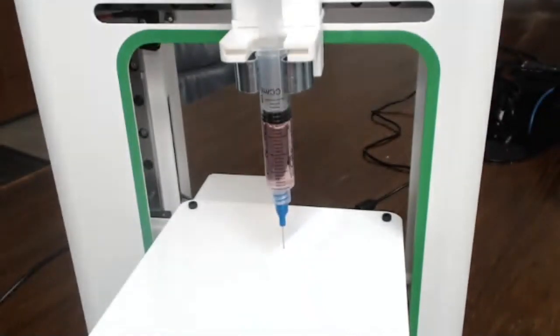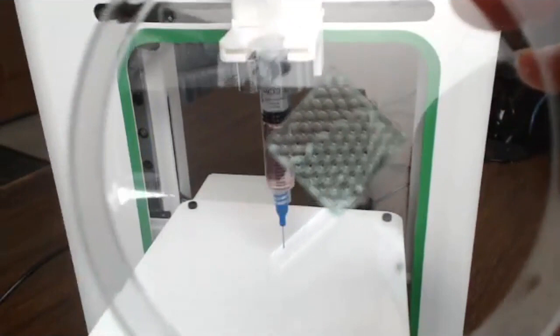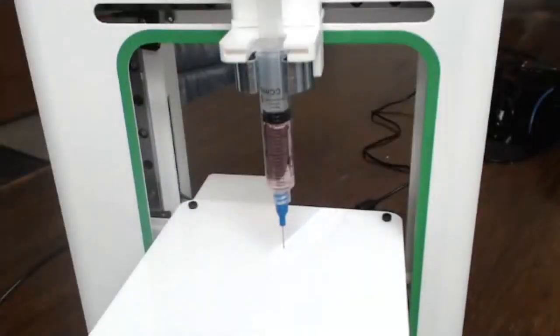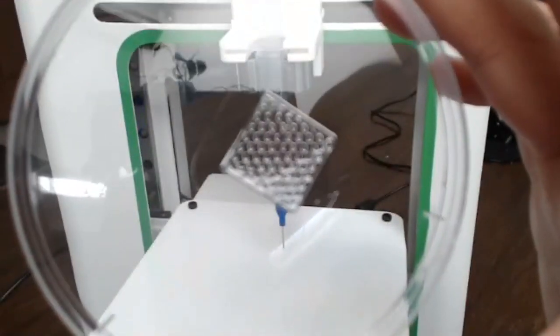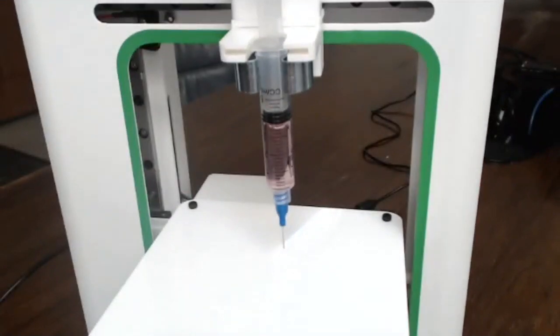And previously this was the green one, which was the 40% Pluronic, right? You can see it looks very similar because we're using the same needle tip. It's hard to see the difference in the viscosity because it's essentially the same material, but the 35% is definitely a little bit runnier compared to the 40%. So that's the second setting that we wanted to show you guys: when you adjust material viscosity, what do you need to change?